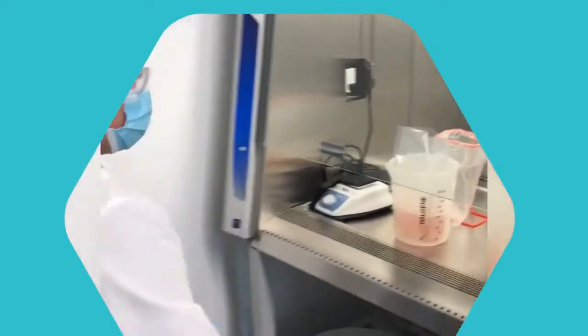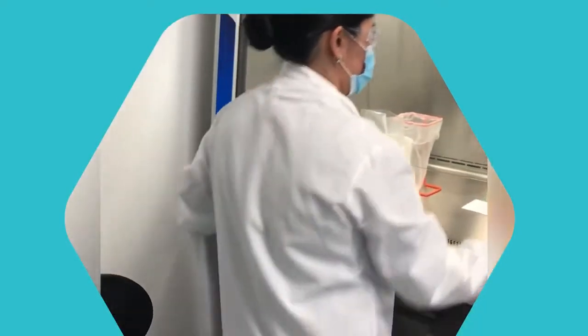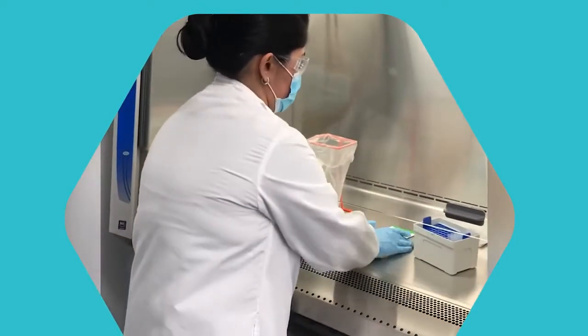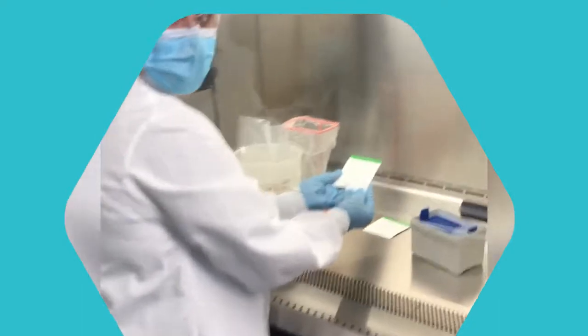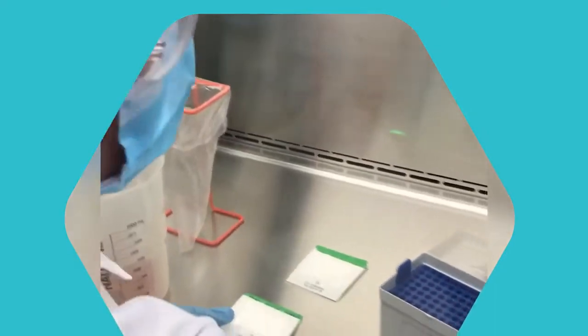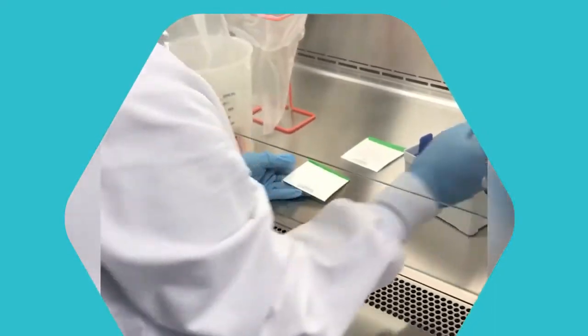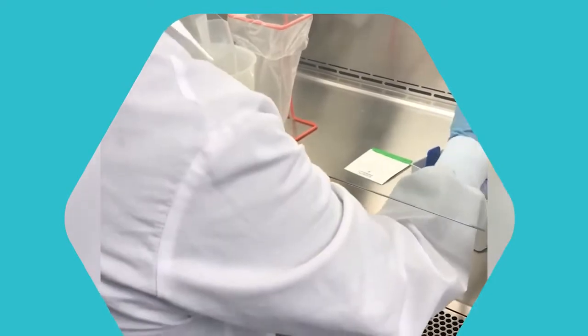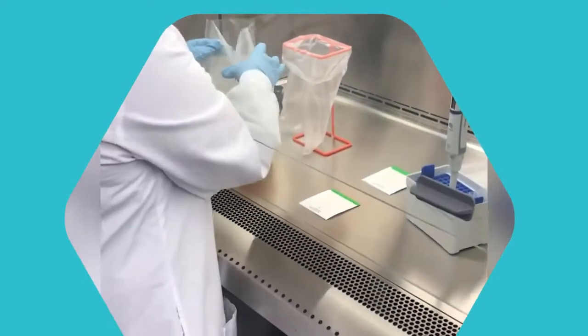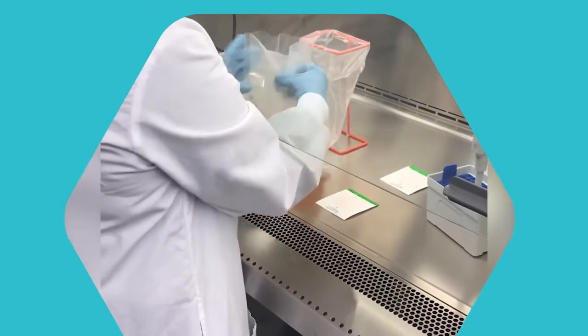And then we'll have the pipetter. We have these MC media pads, which we're going to put our extracted samples into, and then we're going to incubate this. So we'll have the one milliliter pipetter. This is our sample. Take our sample.